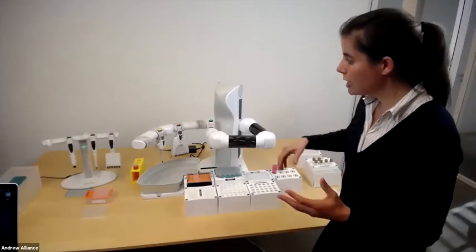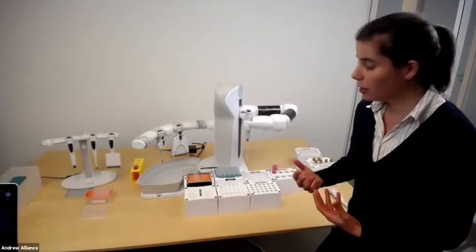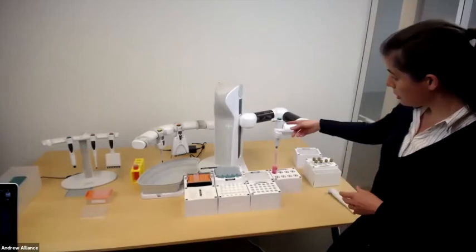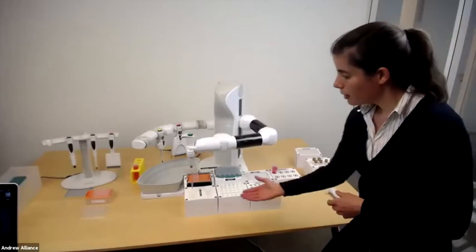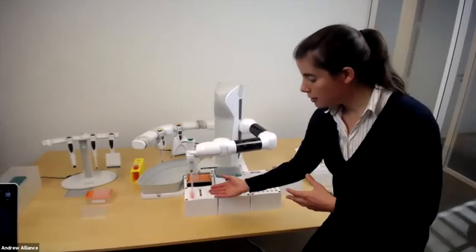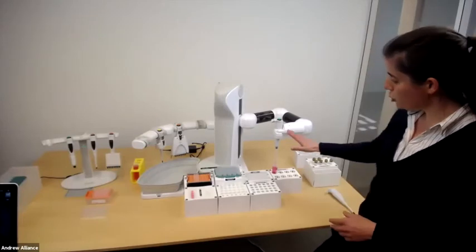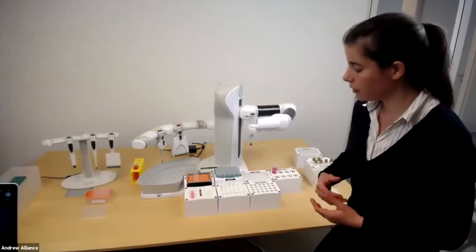Again, as Nigel mentioned, these pipettes are top-of-the-line Picus pipettes from Sartorius. They have an added capability built in, a Bluetooth capability, that allows them to communicate to the robot and in turn to OneLab as well. So the volume is set to 5 ml. He's taking the buffer. He's going to a reservoir right now. In terms of speed, aspiration speed, dispensing speed, mixing speed, this can all be changed. And you will also move the liquid level to make sure that he's always taking up liquid and never air.